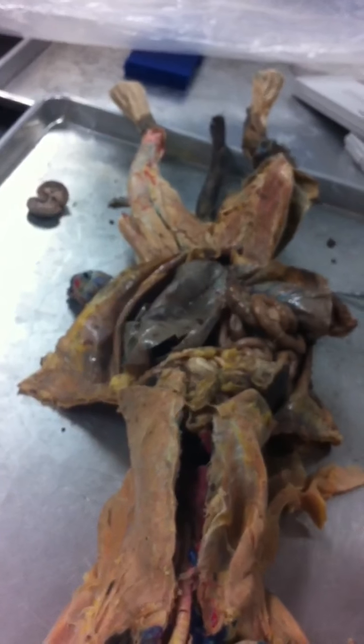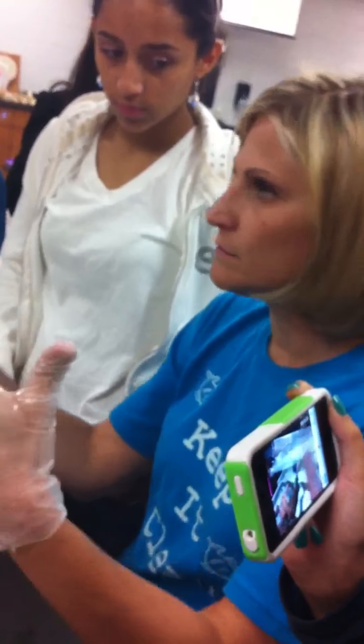The tubules come together and combine with the urethra in the cat's penis. If you think about the penis, again, think of male anatomy. With humans, the main portion is just going to be considered penis. The end of it, or the head of the penis, is called the glans. No D.